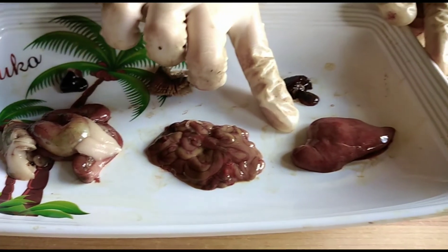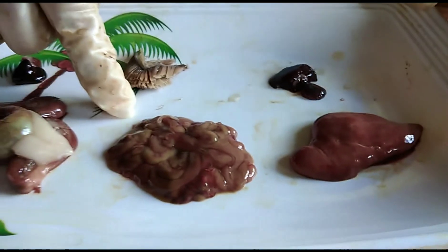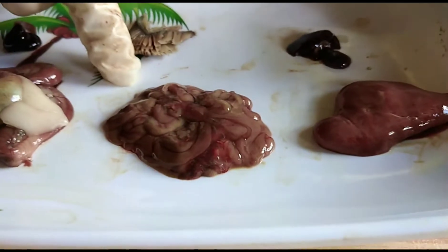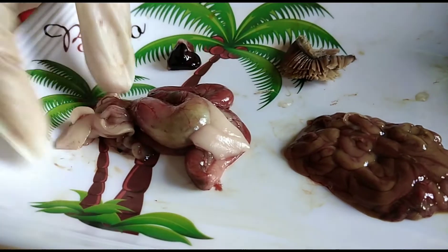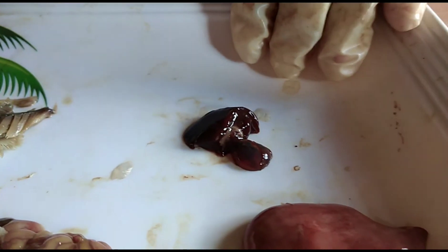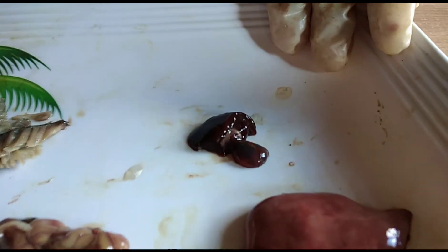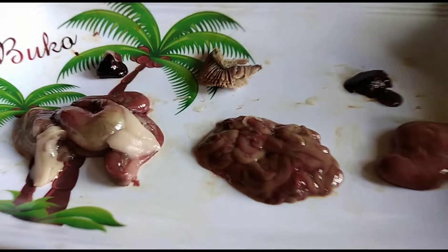This is the liver, which assists in digestion. The intestine — the main function of the intestine is to digest food, but fish has only one intestine. This part has food and gas inside. And this is the gallbladder and stomach. The gallbladder is a warehouse for the bile that is created by the liver. Here is the gallbladder, and here are the gills and the heart. These are the internal organs of the fish.